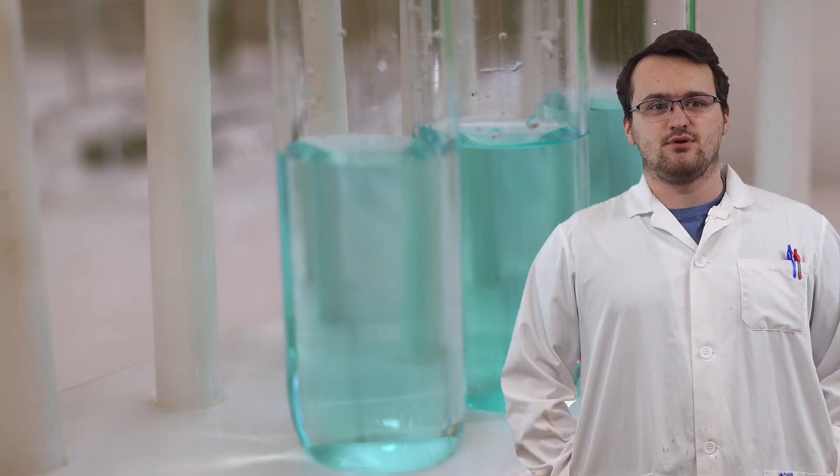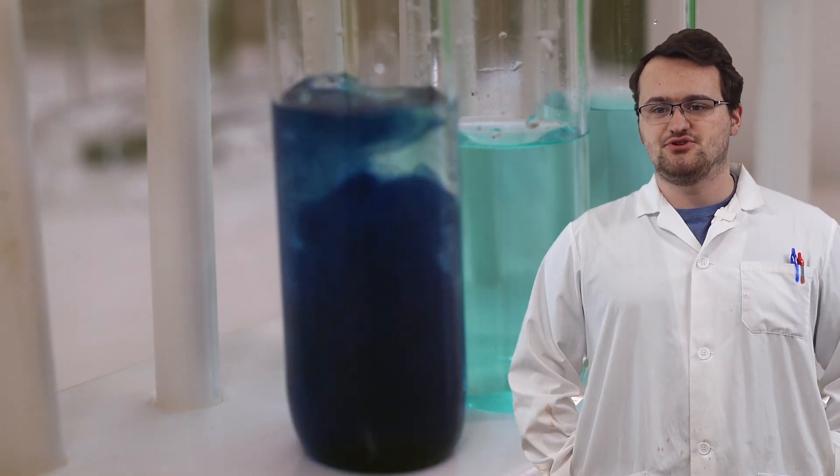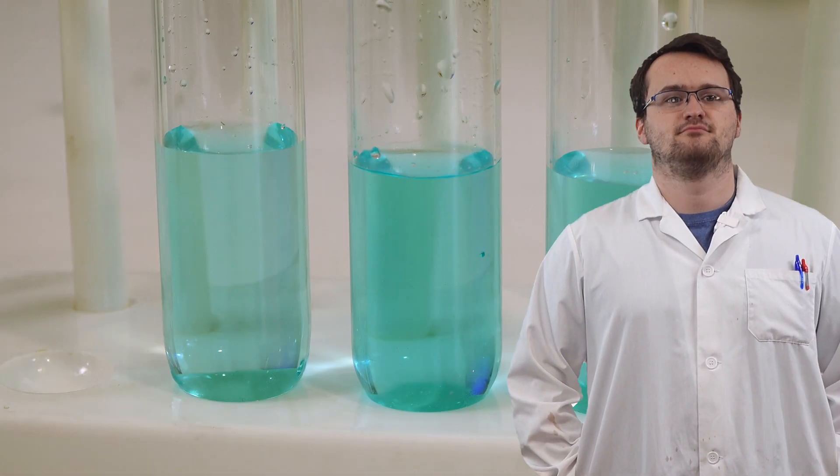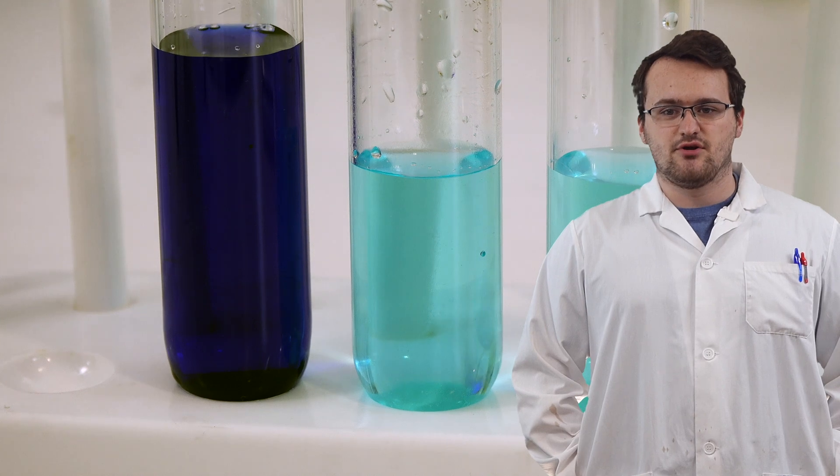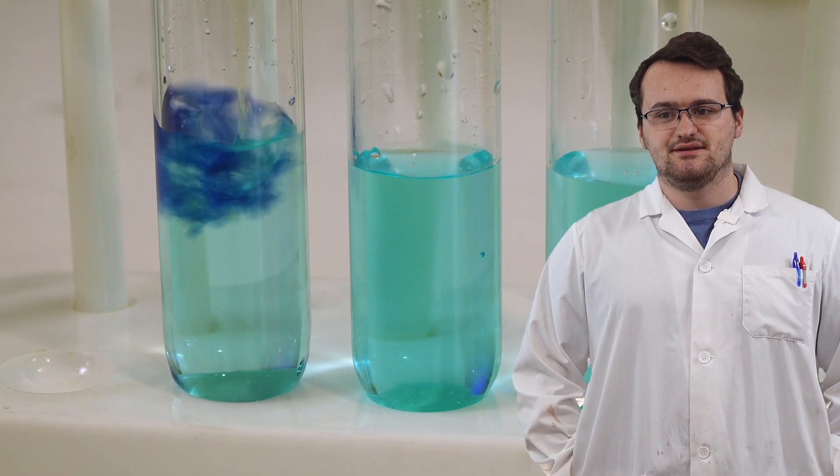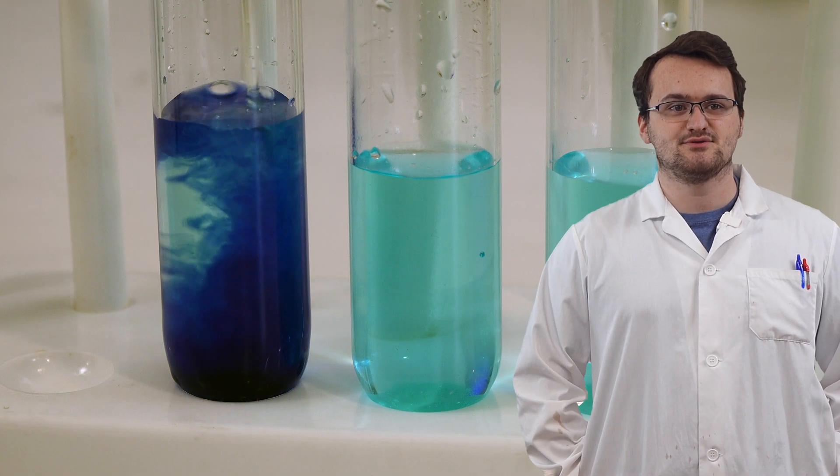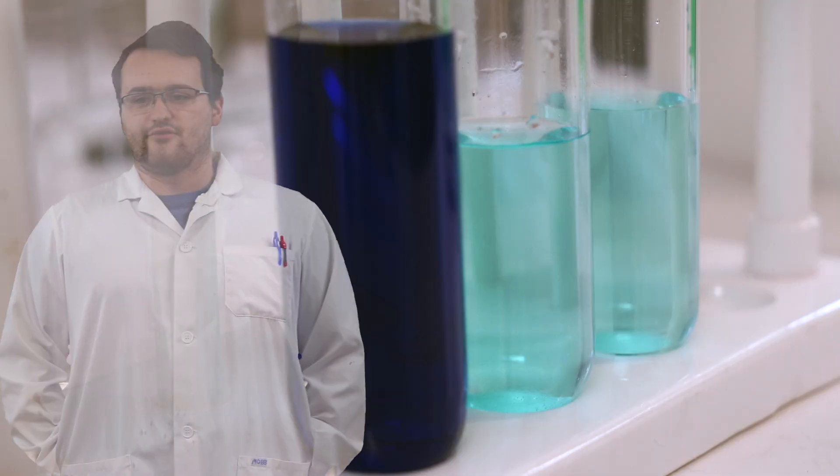Alright, so first on your left, we're going to add some ammonia to our copper chloride solution. This blue color of the copper ammonia compound is pretty much my favorite color. It's one of the reasons why copper is such a great element.